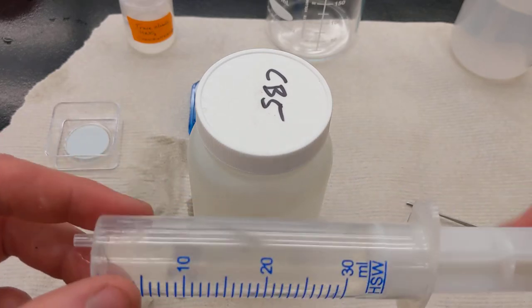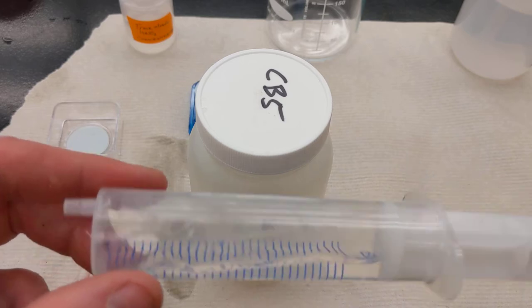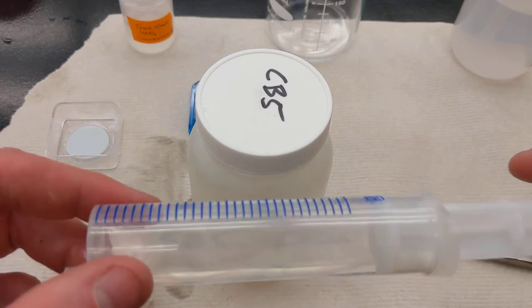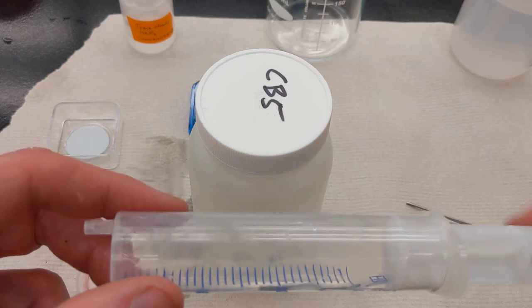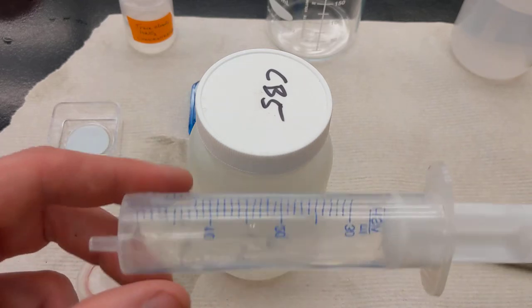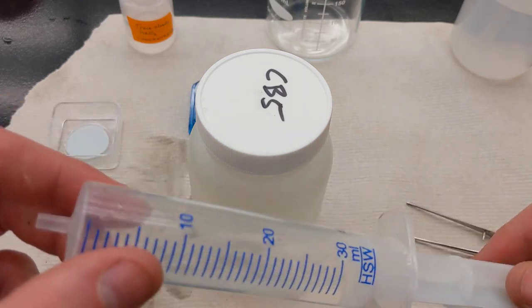And so this is my pre-rinse, so that I can rinse my actual tool with the sample. That minimizes any dilution from leftover DI, and it makes sure that I can coat the object with my sample itself.